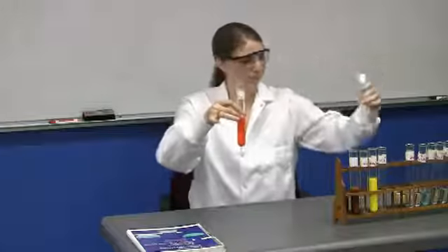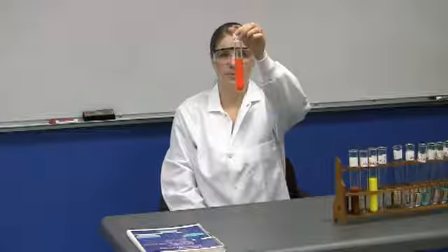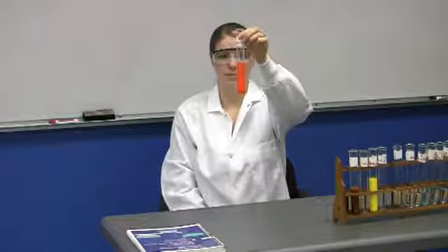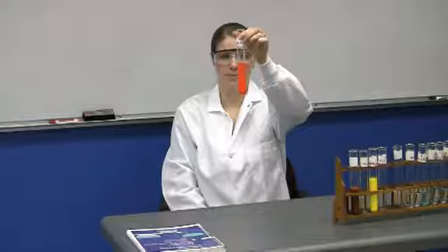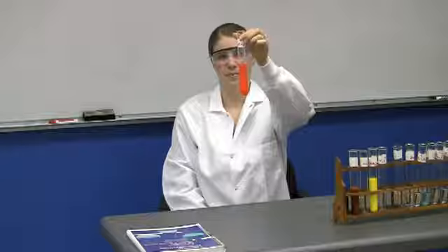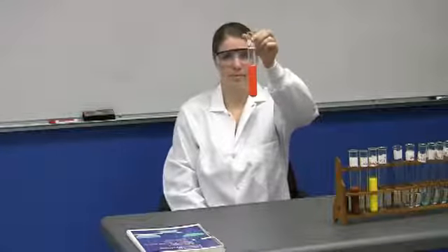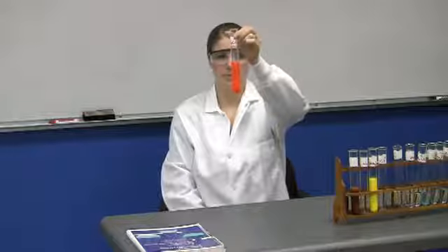Now, something the inorganic students in the audience will find out about later is why we have a different color when one of the reactants here was the same as the first pair of reactants, and that's mercury 2 chloride. But that's another subject. So here we get quite a nice orange precipitate. Okay. So far so good. We're halfway through.